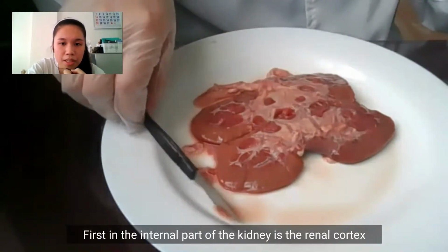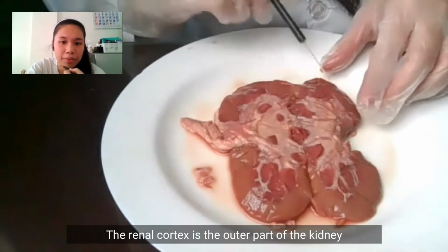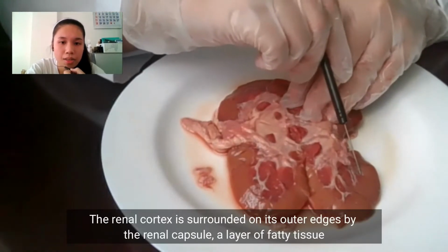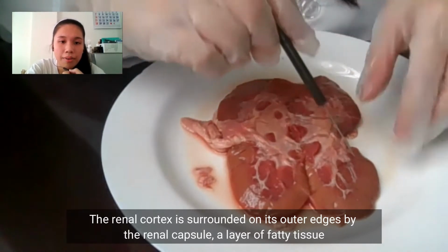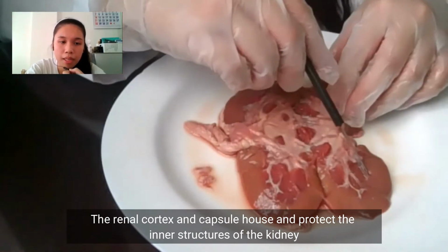Okay, so first in the internal part of the kidney is the renal cortex. The renal cortex is the outer part of the kidney. It contains the glomerulus and convoluted tubules. The renal cortex is surrounded on its outer edges by the renal capsule, a layer of fatty tissue. Together, the renal cortex and capsule house and protect the inner structures of the kidney.